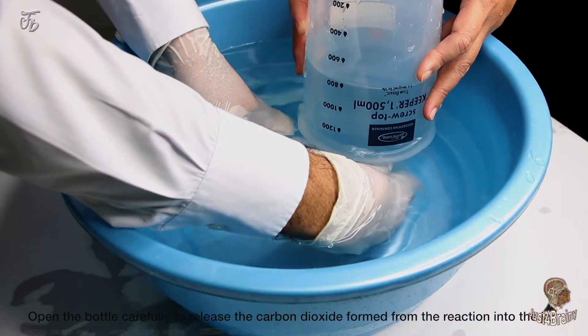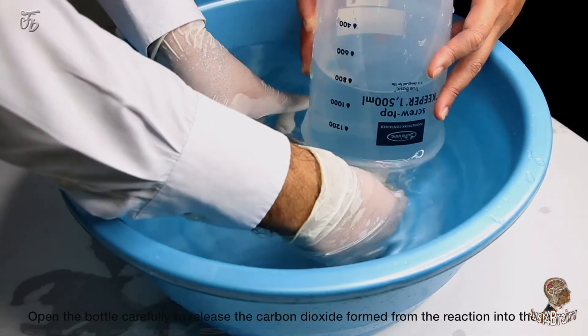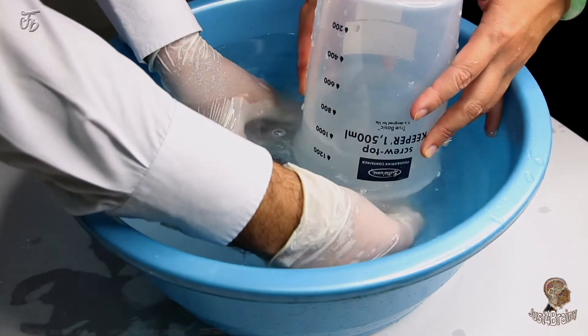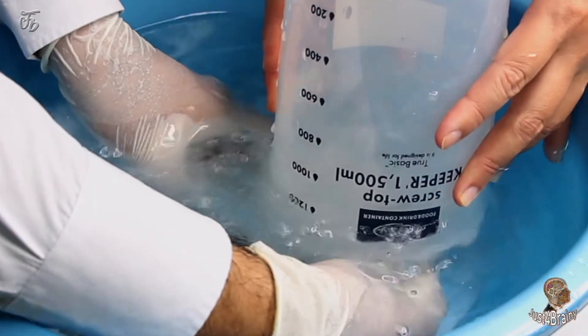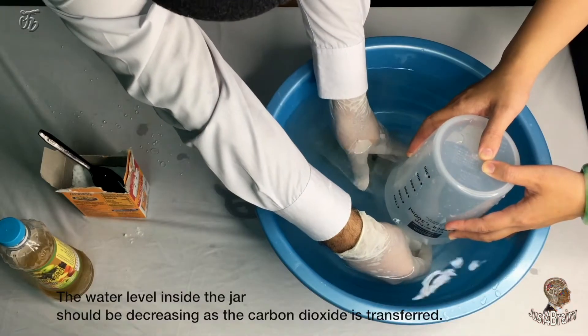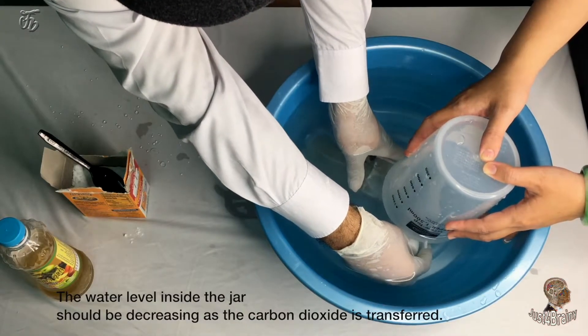Open the bottle carefully to release the carbon dioxide formed from the reaction into the jar. The water level inside the jar should be decreasing as the carbon dioxide is transferred.